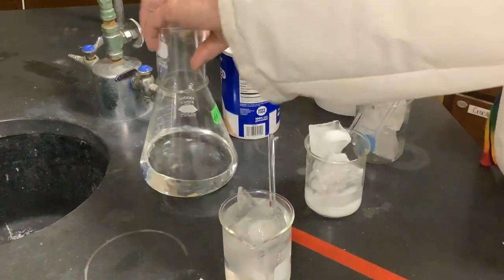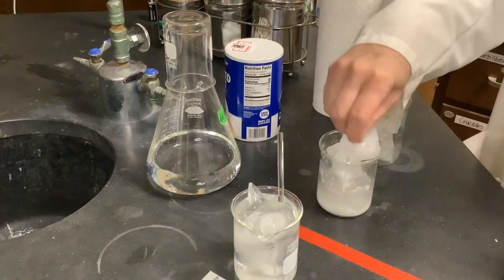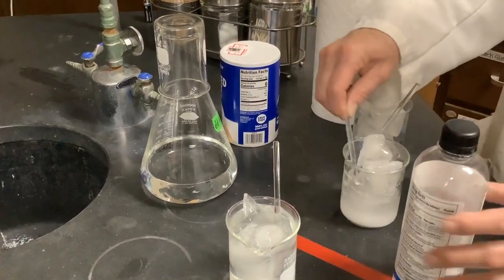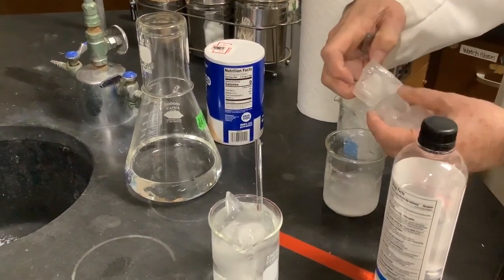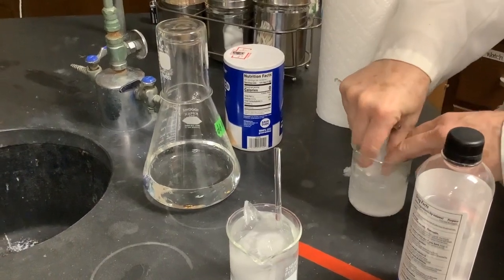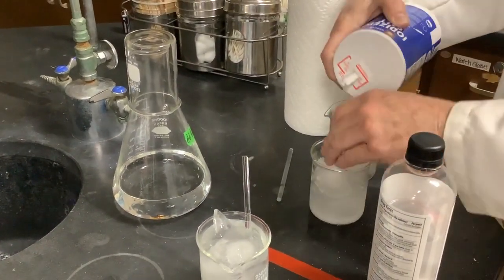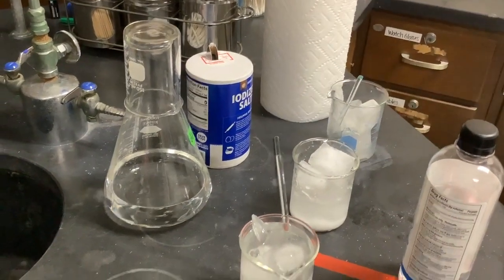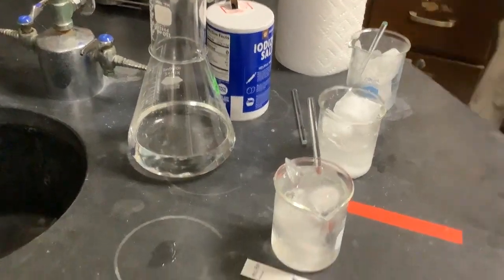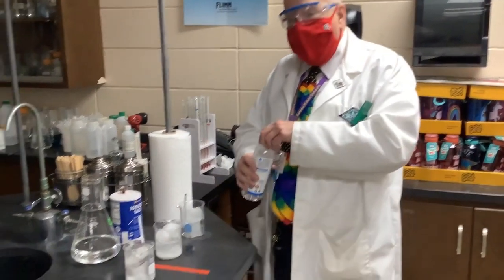Some of you may have made ice cream and know that you add salt and ice to make your system extremely cold. Trying to get another ice cube in the water so that we get that very effective cooling. This ice has already started to stick to itself. So let me try that again now that I've disrupted it. This is just plain old Walmart salt, and I'm going to put it on the ice and keep it there so that it helps that ice undergo a phase transition. It's going to melt it, but as it does, it's going to absorb energy from the system, from the water, and lower the temperature of the water.